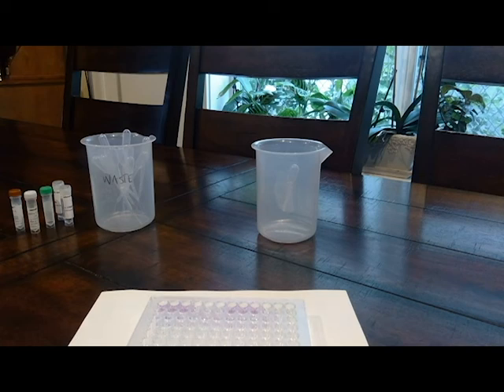You'll just want to rinse the microtiter plate and your pipettes in tap water, and then wrap them in an opaque plastic bag and discard them in your trash. You'll want to clean off your work surface, which is my table, with another disinfectant wipe or multi-purpose cleaner.